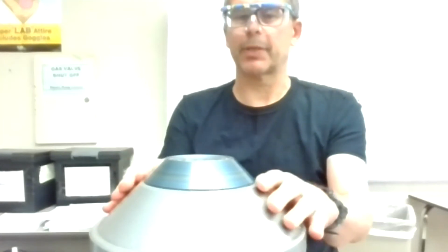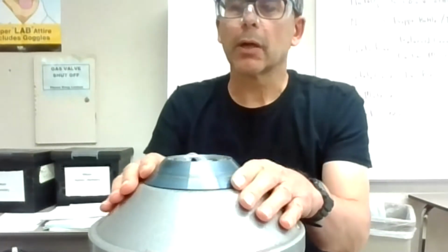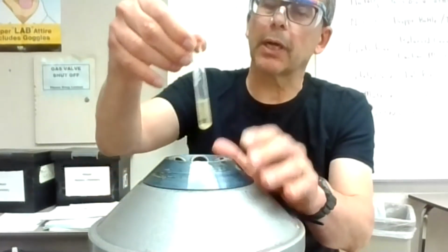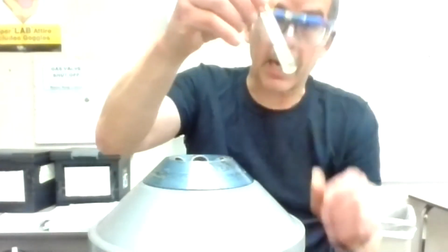Okay, I'm going to stop the spin here. I'm curious to see what this looks like on video. There's not a lot of stuff there, but there's that haziness on the glass. So it's not sitting in the solution. It's haziness all over the glass, and that's what we look for with strontium, is how it frosts the outside of that glass.